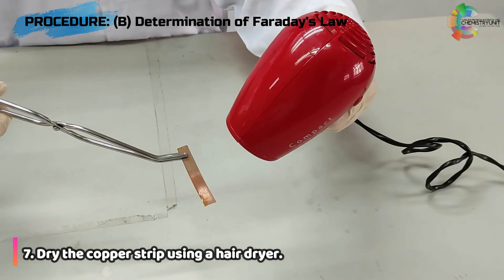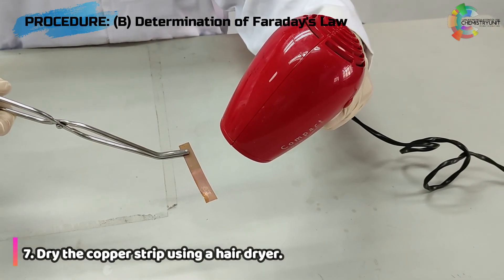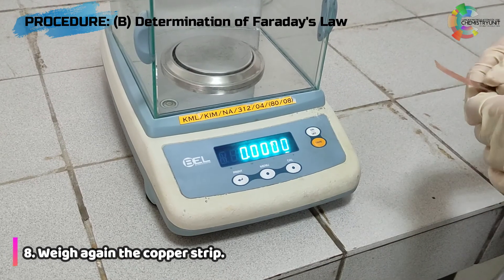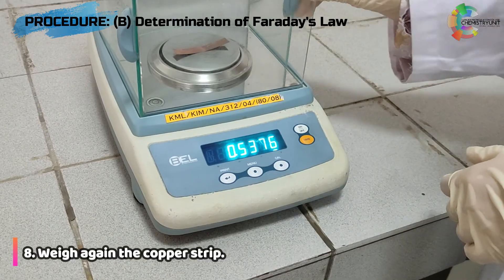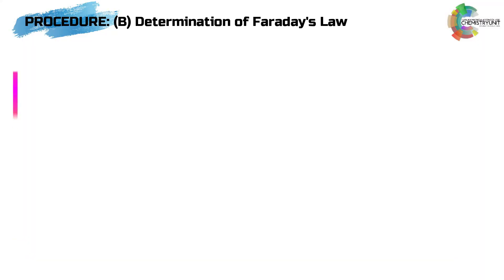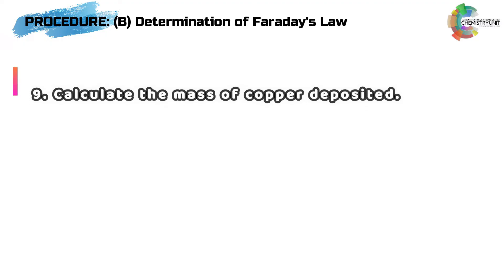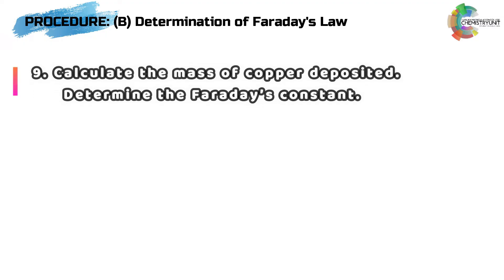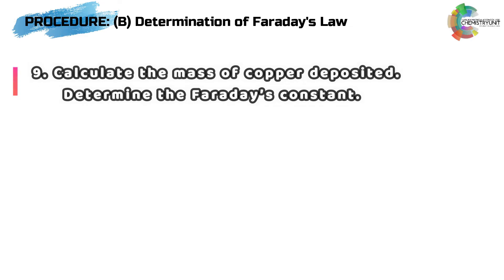Dry the copper strip using a hairdryer. After that, weigh the copper strip again using the analytical balance. For step 9, calculate the mass of copper deposited and determine the Faraday's constant.